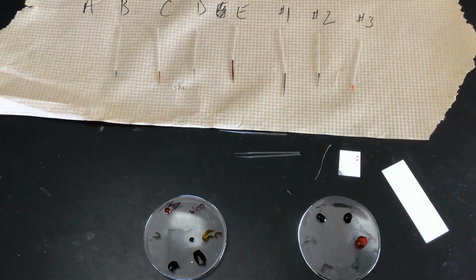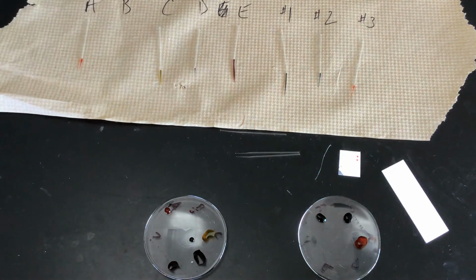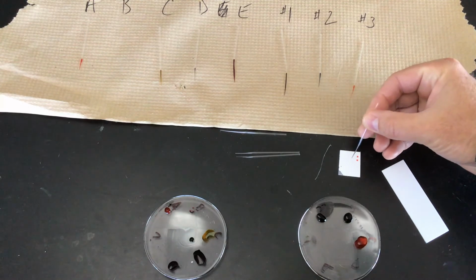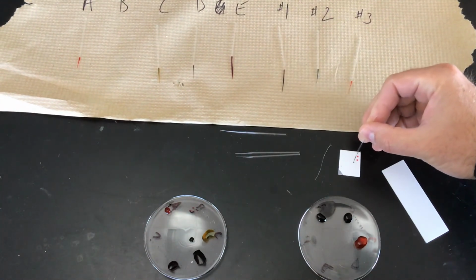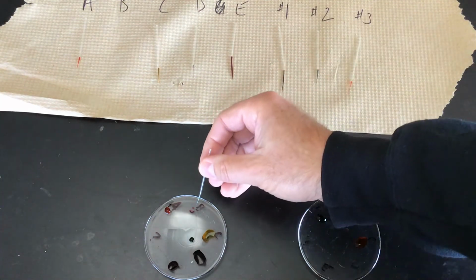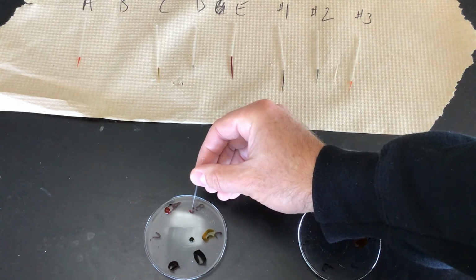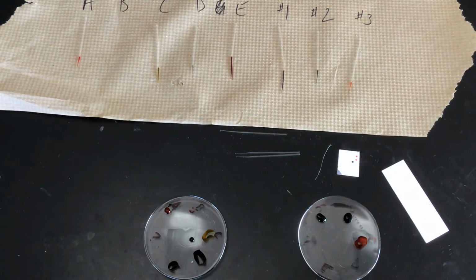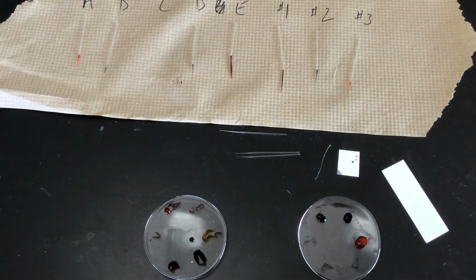All right. And so this gives you an opportunity to kind of practice, but also lets you know if the spotter that you made is going to give out enough dye. So this one here, I have to go a lot more up and down, and this was B, so I need to get more of that before I actually spot my plate there. So again, you're just practicing with these, and making sure you're not giving out too much of the liquid.